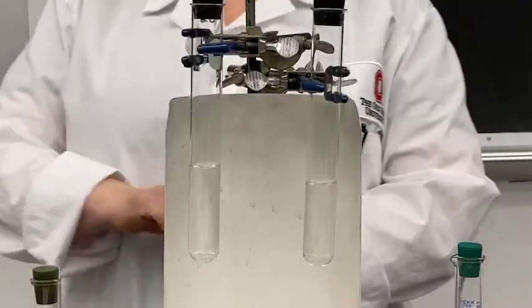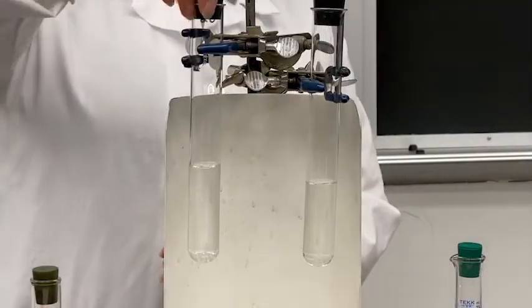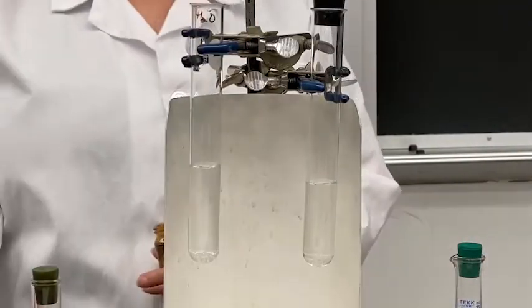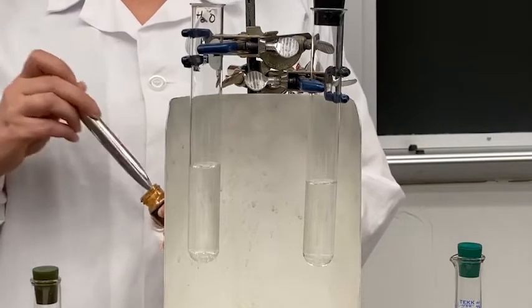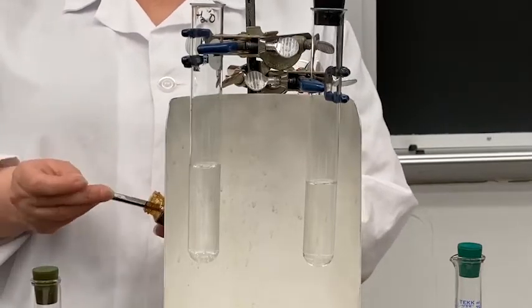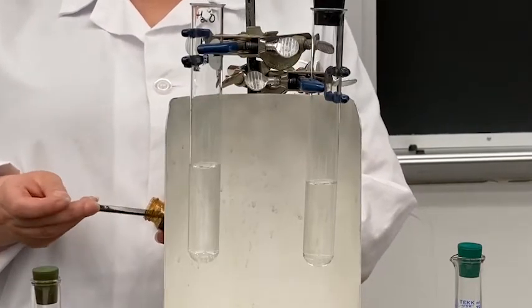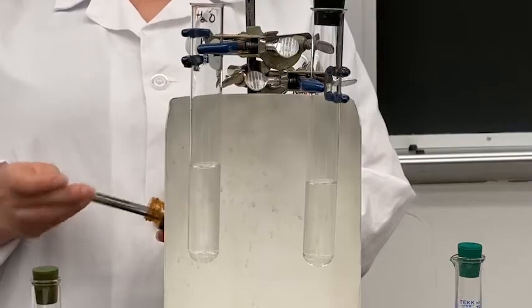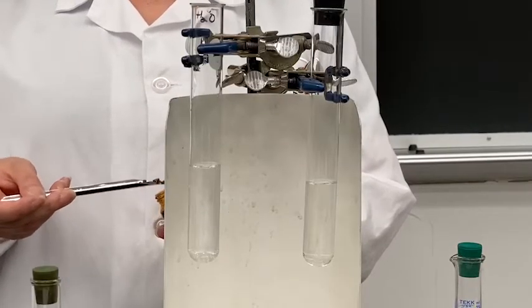I'm going to add some iodine to the water. Iodine is nonpolar, so it shouldn't dissolve, but I will warn you the water takes on a little bit of a brownish tint because iodine has a really high vapor pressure.